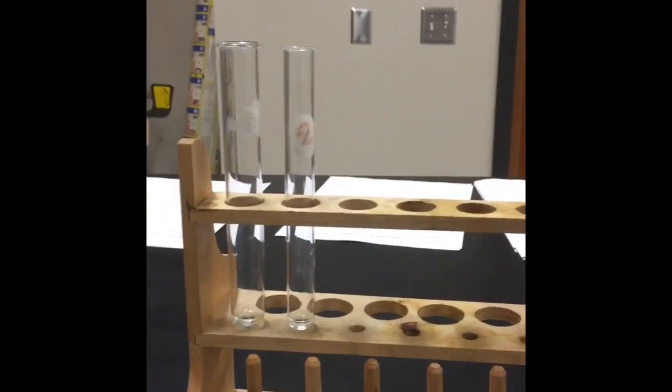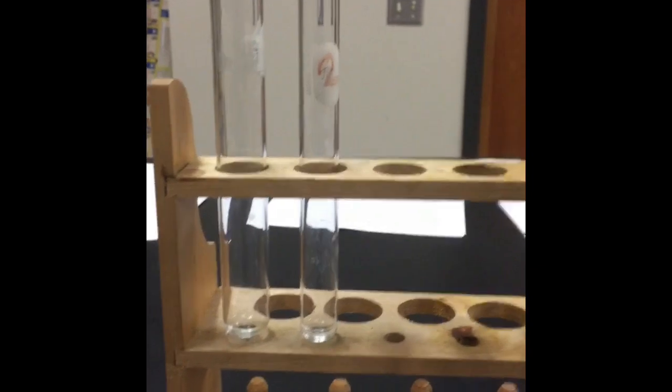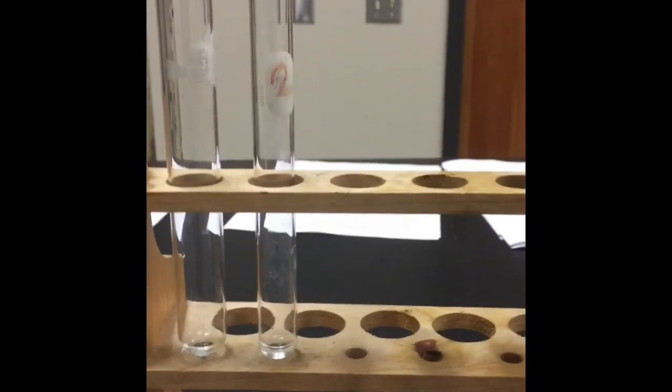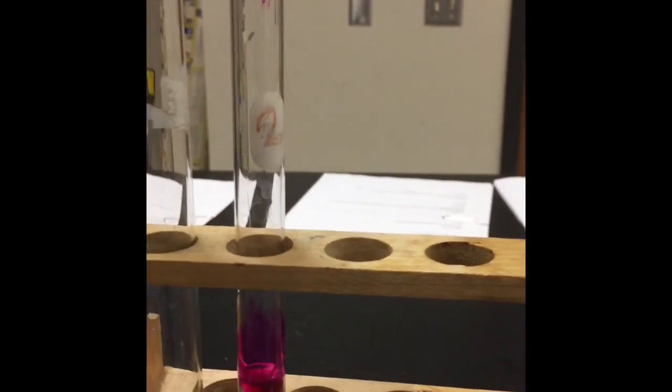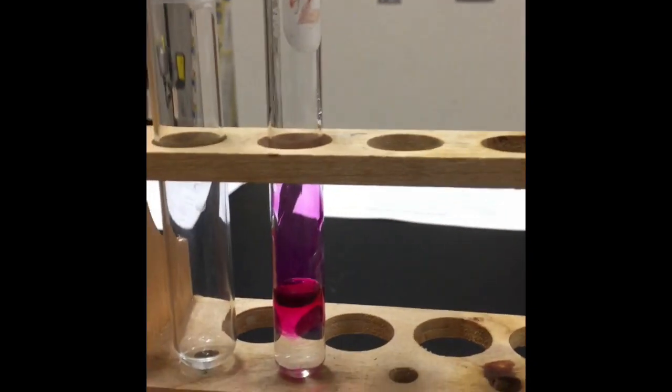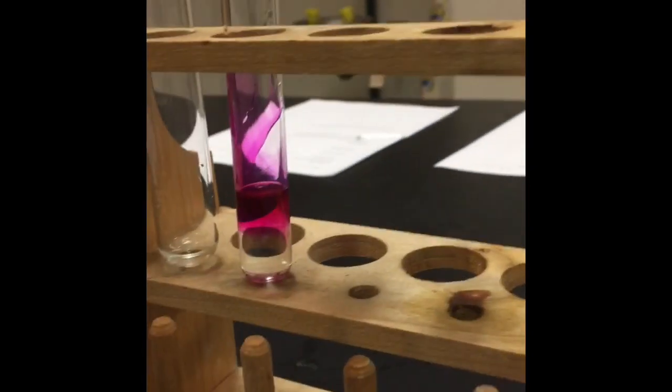Okay, so at the last lab station 6, we actually have reactions 7 and 8. So I'm going to go ahead and do reaction 7. To one of the test tubes, I am just going to add some sodium hydroxide. Okay, so all that's in there right now is sodium hydroxide. Now I'm going to add a drop of phenolphthalein, which is a pH indicator. That color indicates that this is a basic solution, which is not a surprise. It's sodium hydroxide, contains hydroxide, so it's a base.